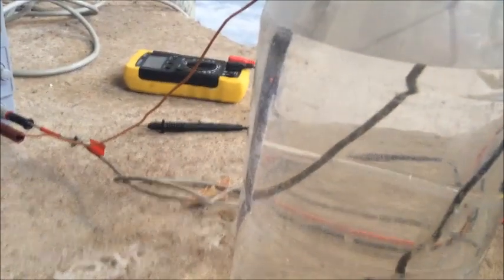Here we are — just had to grab the multimeter to check that all the connections were correct, and they are. I put bore water in there, so it's already got a lot of salt dissolved in it. We'll connect it up — that's quite a high voltage, why not? And we can see it's starting to get some electrolysis happening. It's pretty slow, so I'll add some salt — that'll increase the speed of it quite significantly.